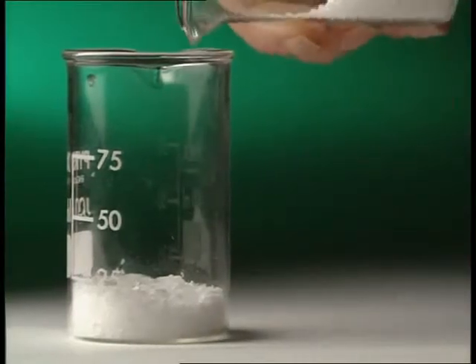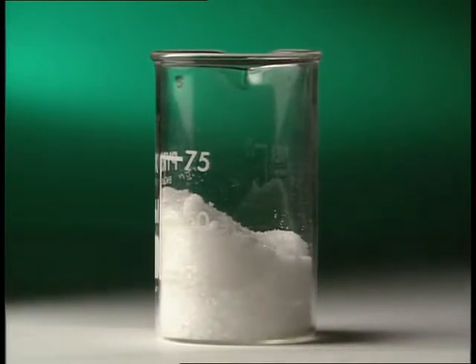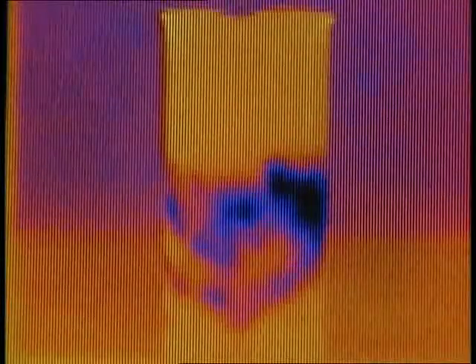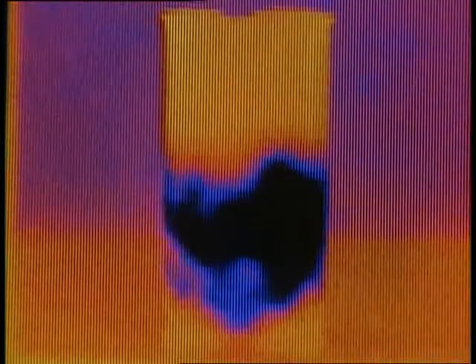But not all reactions give out energy. Add barium hydroxide to ammonium thiocyanate and nothing much seems to happen. Look again through a thermal camera — cool objects appear blue, even black. The reaction is taking in energy from its surroundings. By taking energy from the beaker and the chemicals themselves, the whole thing is cooling down. It's an endothermic reaction.